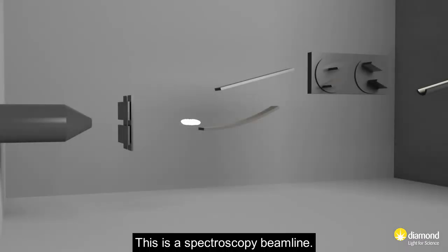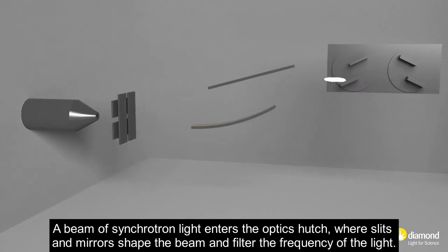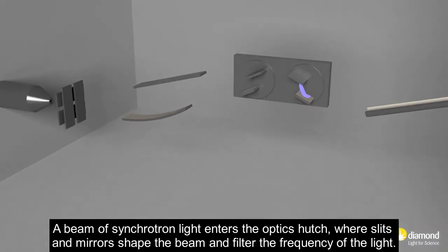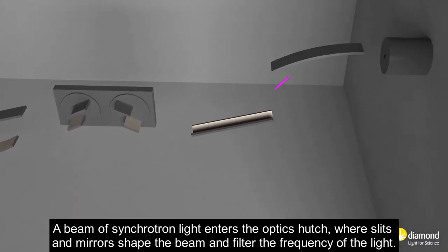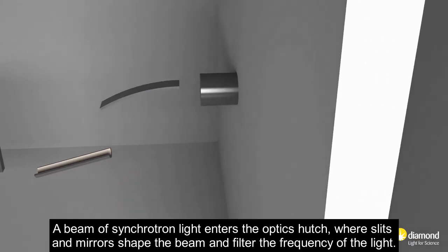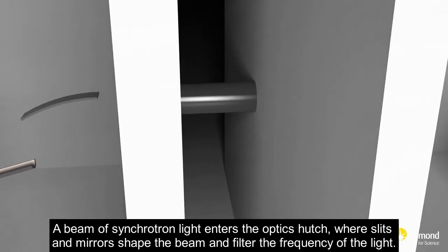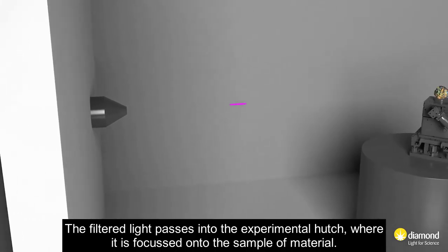This is a spectroscopy beamline. A beam of synchrotron light enters the optics hutch, where slits and mirrors shape the beam and filter the frequency of the light.